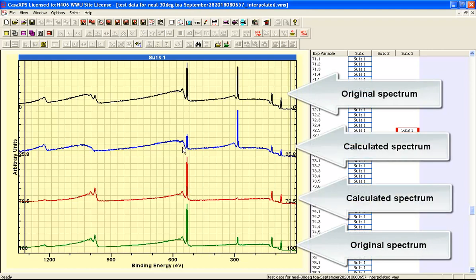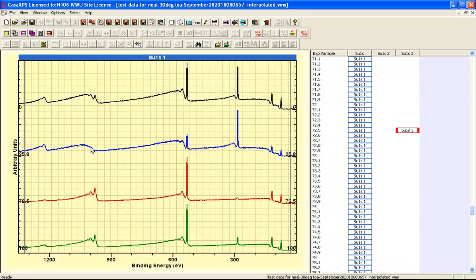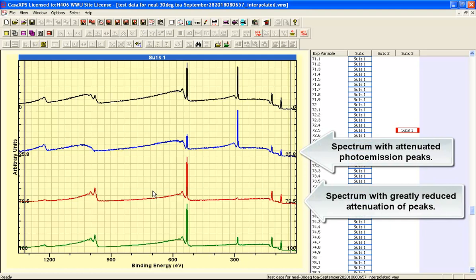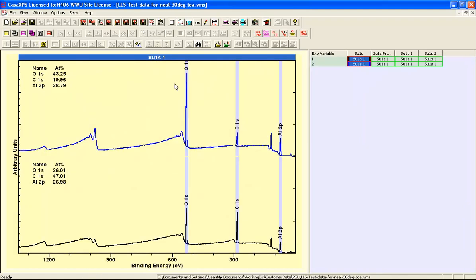And the two calculated spectra are the blue and the red. And the blue one represents what we will interpret as a spectrum that has got a significant overlayer thickness. And the red one is the spectrum that has a thin film on the surface, and their substrates are both identical, this is the assumption anyway, as aluminium oxide. So if we go back to these data, you can see that the file that I've got here is actually a linear least squares result file.